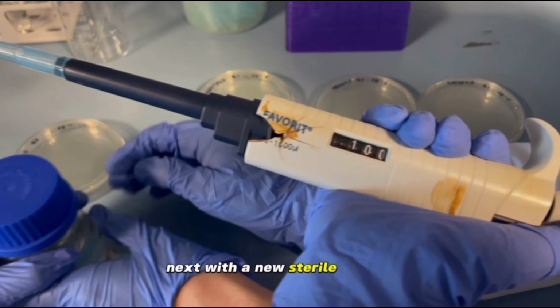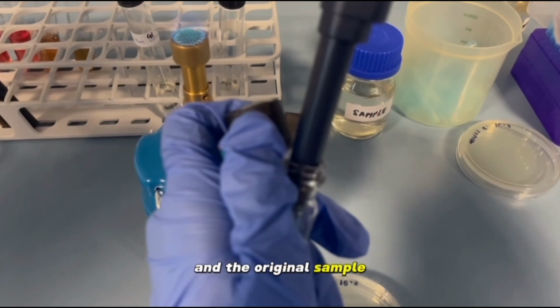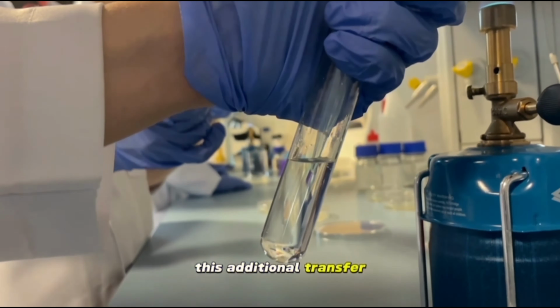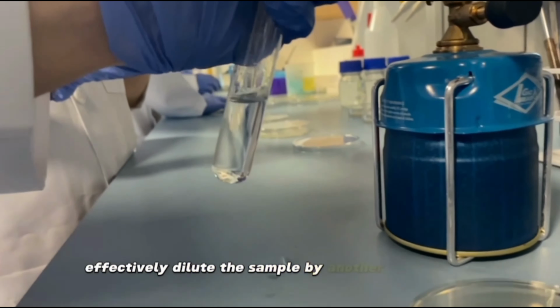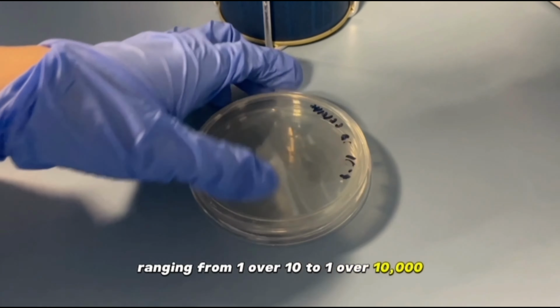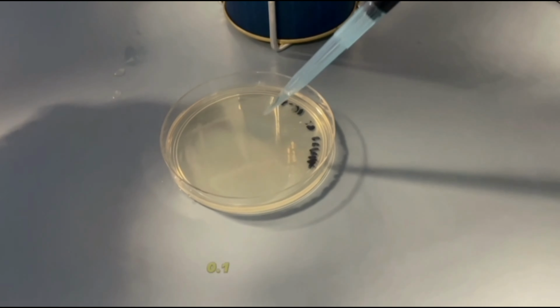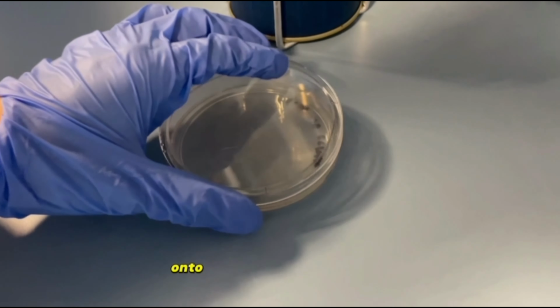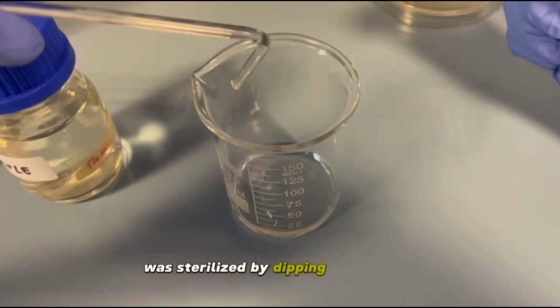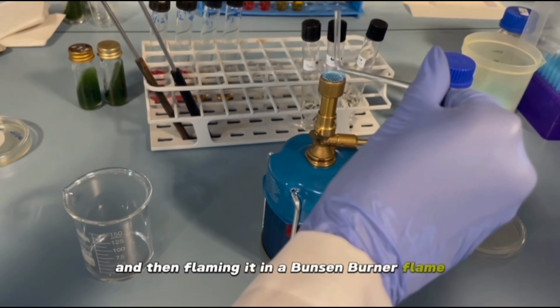Next, with a new sterile pipette, 0.1 ml from each dilution tube and the original sample was aseptically transferred to agar plates. This additional transfer effectively diluted the sample by another factor of 10, ranging from 1/10 to 1/10,000 of the original concentration. Starting from the greatest dilution, 0.1 ml was pipetted onto its respective agar plate. The glass spreader was sterilized by dipping it in alcohol and then flaming it in a Bunsen burner flame.